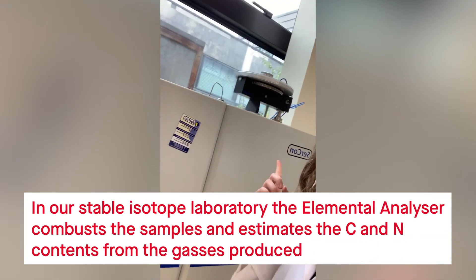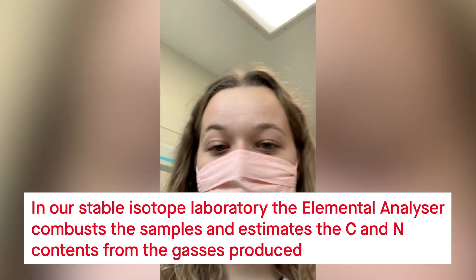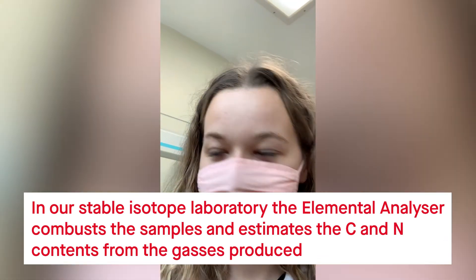And here we have the elemental analyser that's going to tell us the carbon and nitrogen content of all of our samples.